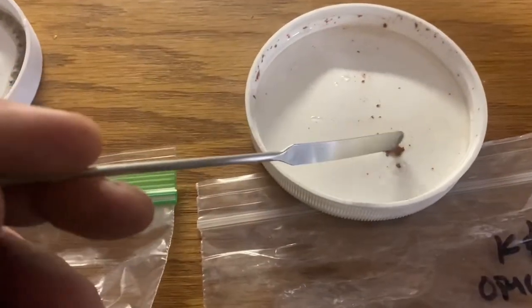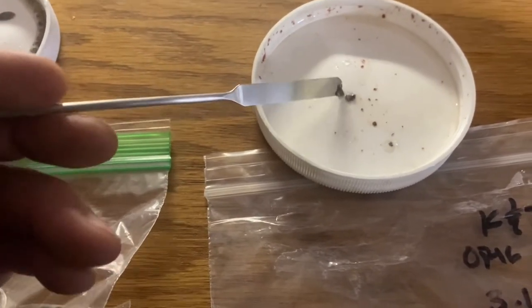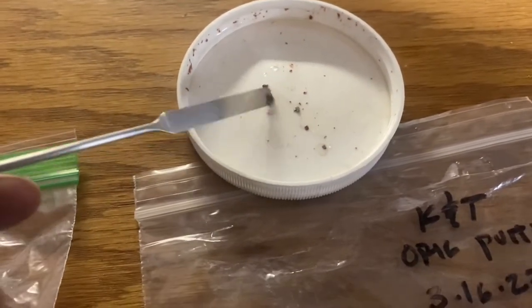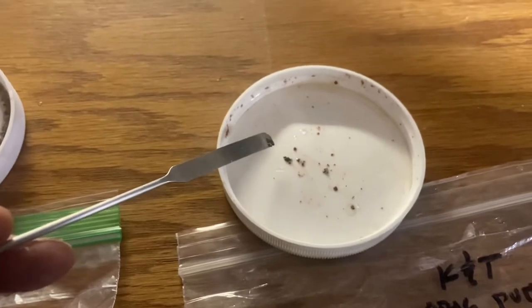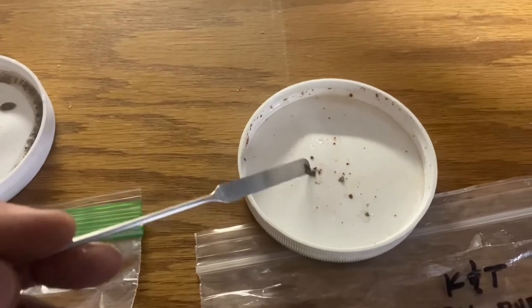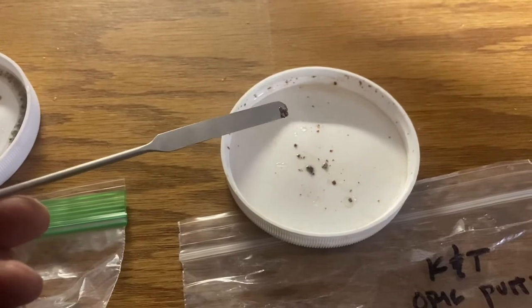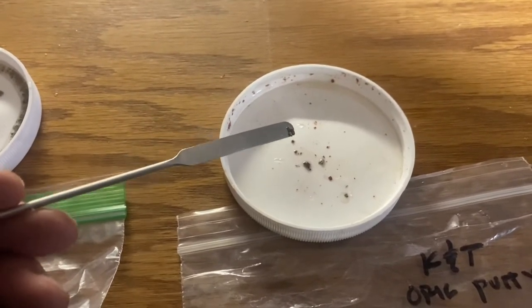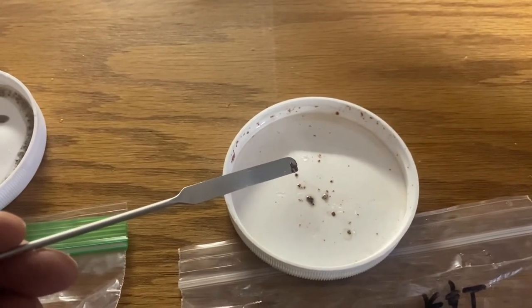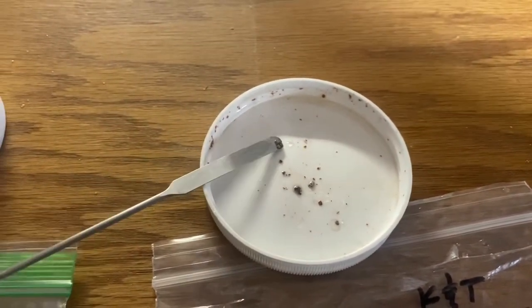Finally, this is what's left of the glazer's putty. These residues sank to the bottom, and this stuff came to the top. I think what's left is interesting — the putty was an odd red color, and for some reason it had a pigment in it, and I think what we're seeing is the pigment. But this is not really a solid; it's kind of like a foam. I had to actually scrape it off the top — the residue was easy because I just rinsed out the muriatic acid, but with this I had to pick it off otherwise I would have lost it. So that's what I found out from these samples.